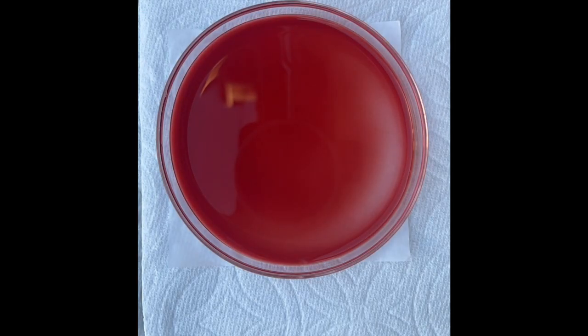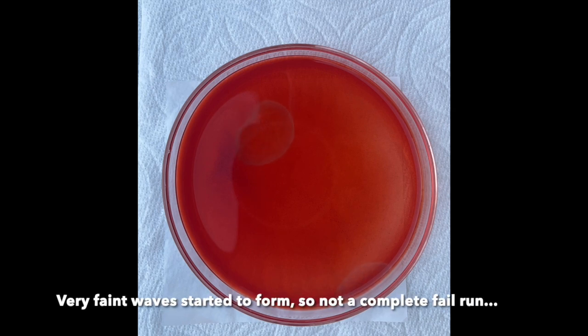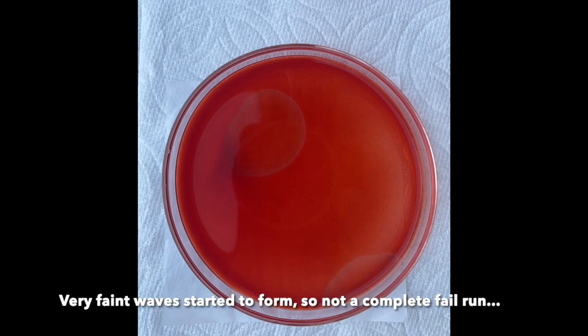However, I believe this actually highlights the beauty of this reaction, which is essentially a chaotic system. Even a slight variation in the conditions could lead to vastly different results, including the formation of patterns or the complete absence of patterns.